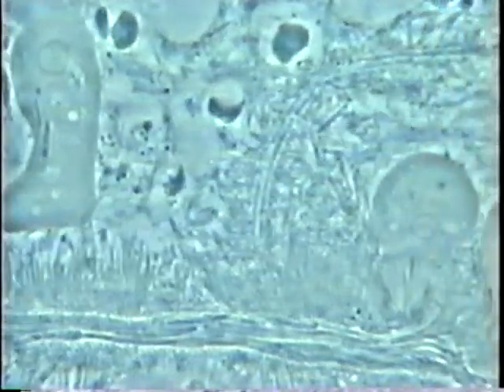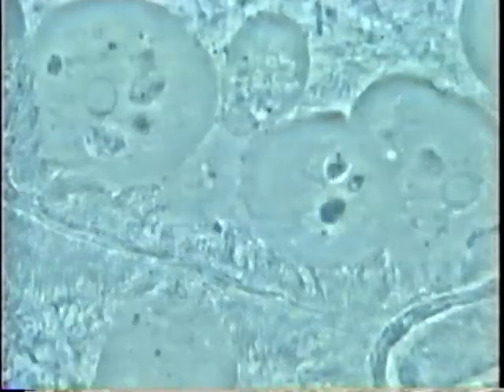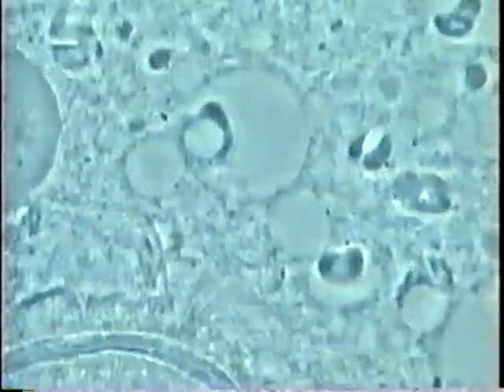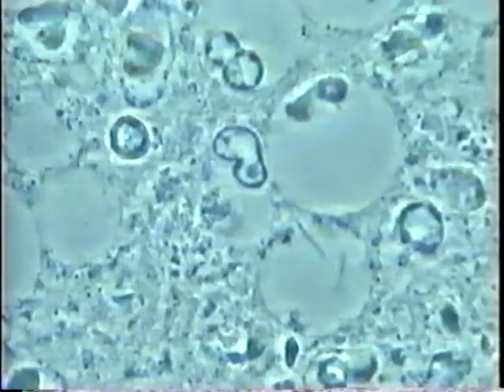They live together. This will probably form future calculus that will stay on the root, and it is nonsense to leave this in your gum and hope that you get well. You have to remove those things. See the activity, see the white cells, see the long filaments and the adherence and activity of the amoeba — very important in this area with the filaments. If you have only bacteria, there's not a lot of bone loss, but as long as you have the amoeba, there is.